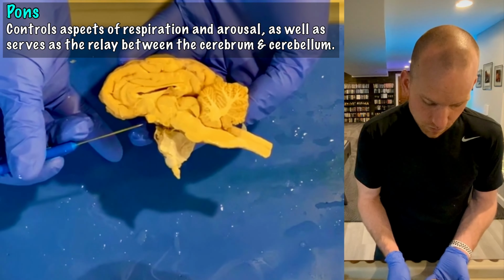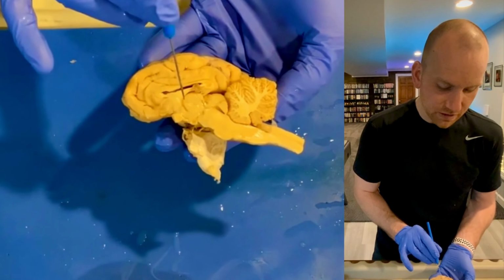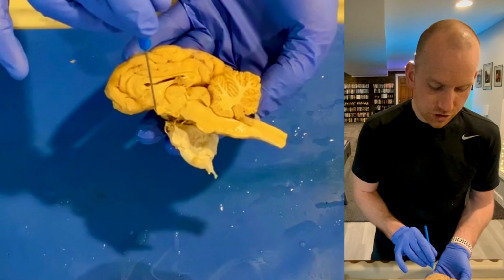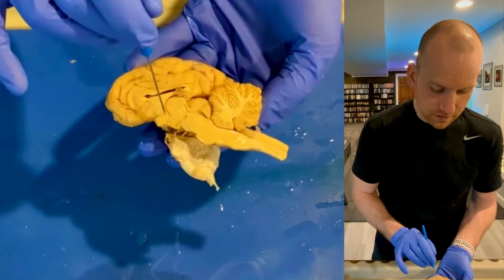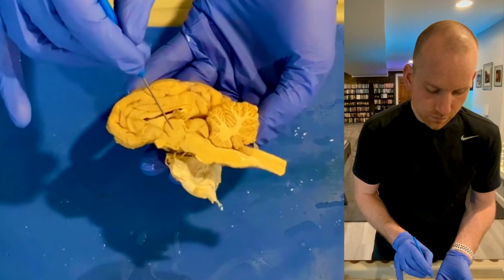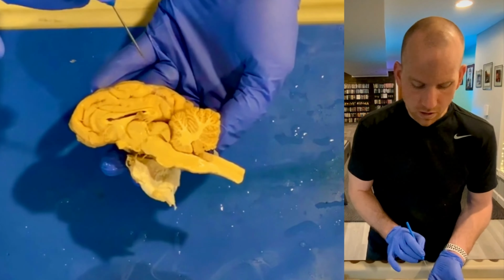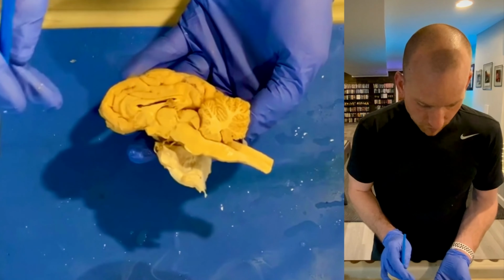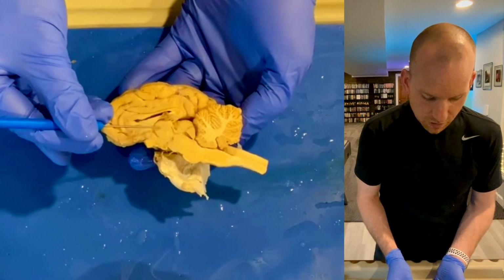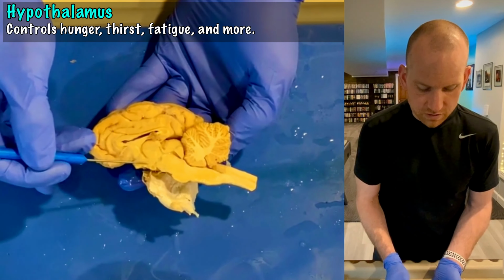This piece right here, though, is the piece I wanted to talk about next, and that's called the optic chiasm. This little bump is actually where the optic nerve would attach, and you'd have the eyeball sending messages. Again, once it comes in on the optic chiasm through the optic nerve, it's going to go to the thalamus first, and the thalamus is then going to push it back to the occipital lobe for processing. So there's only a couple other structures that I want you to know. Remember, if this is the thalamus here, then the hypothalamus is right below it, because hypo means below.